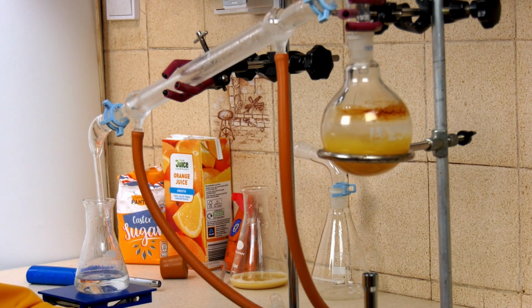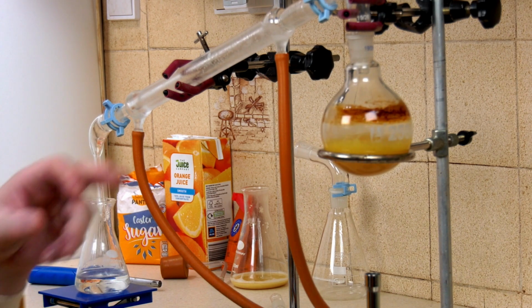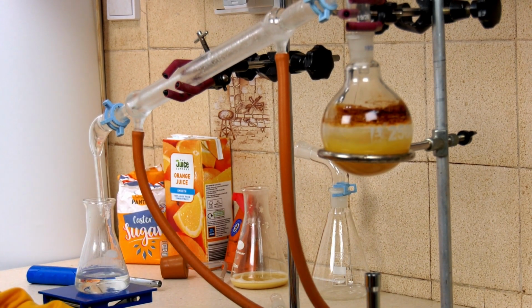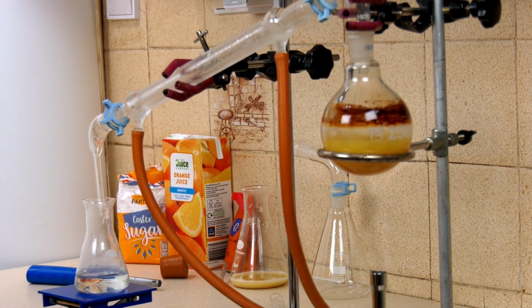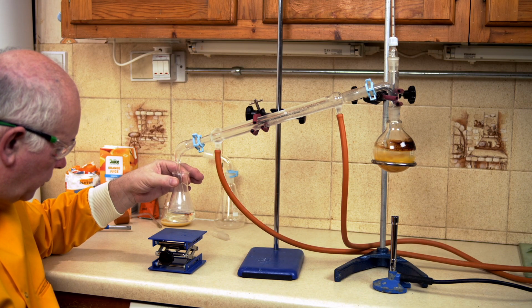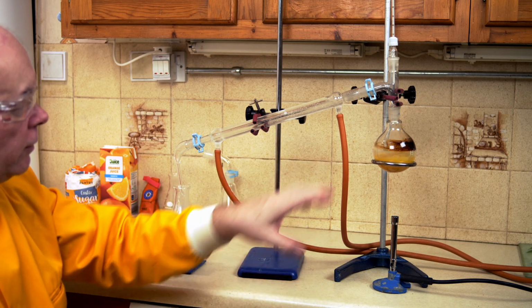And there we go, it's still bubbling nicely, we're still getting alcohol coming off, and we're separating out this alcohol from the orange juice. So we can see they are blatantly different. Orange juice being very orange in colour, and you can see it making a funny mark on the round bottom flask as it's doing so. Yet the alcohol that's coming out here is crystal clear, showing that all the orange is staying there.